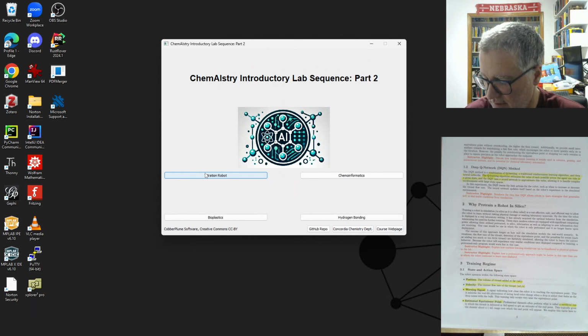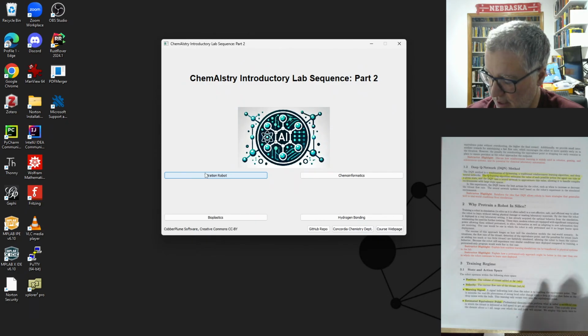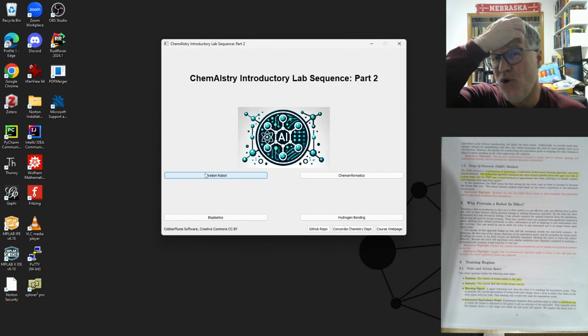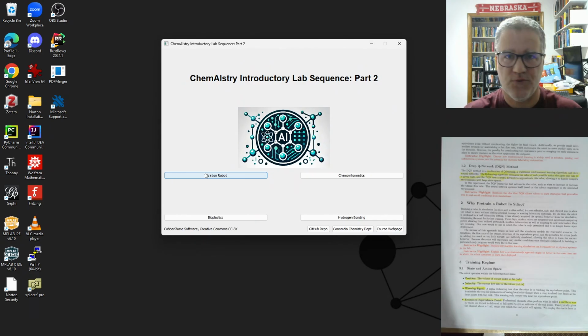Couple of things that are kind of behind the scenes. Just like us, we get a little bit of a warning when we start to get close to the endpoint. The phenolphthalein indicator in this particular case, or just the indicator in general, will often start to turn a little bit and then fade away. And then we know we're getting close to that endpoint. So I've built in a little warning for the robot that it is getting close to the endpoint. And then the other thing we often do, and you've maybe done this when we're taught how to do titrations, is we often do a sacrificial run the first time, because we have no idea how much it's going to take, unless we have some information about, like, it's approximately this concentration or that concentration.